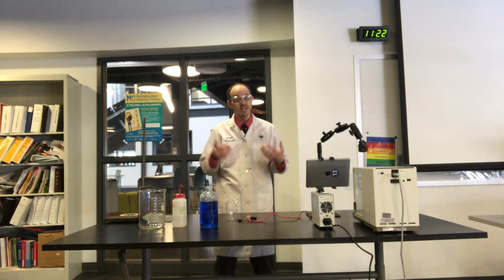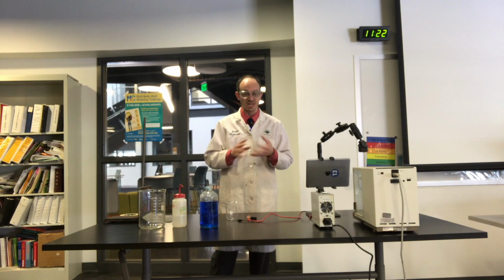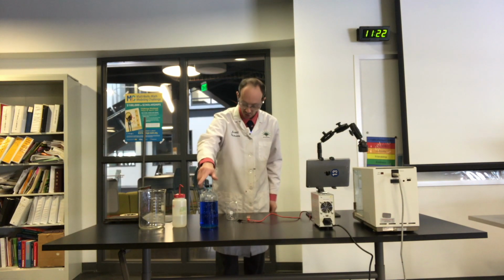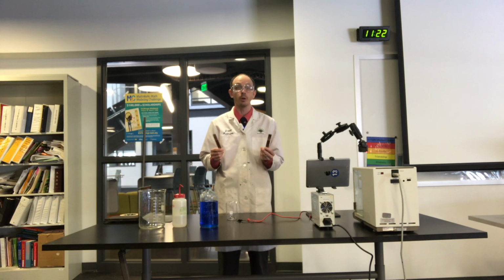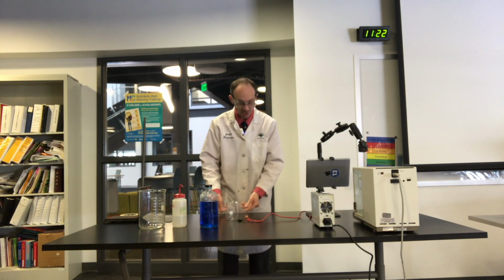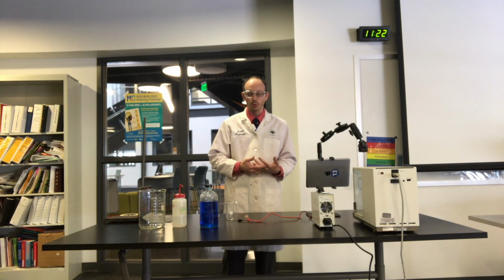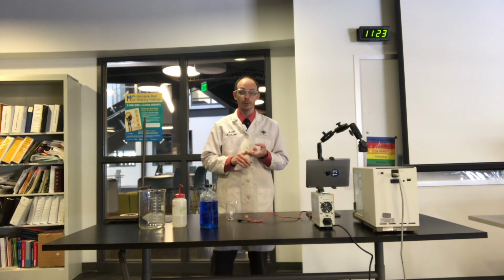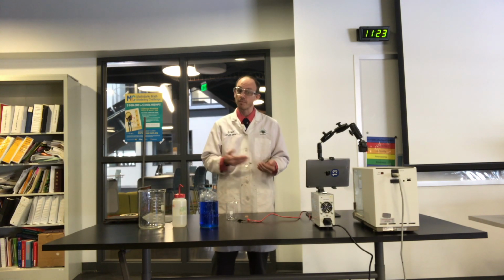Okay, ladies and gents, today we're going to do another electrolysis, only we are going to just be using copper and copper sulfate for today. Because all we want to do is transfer copper from one electrode to another electrode and be able to trace the mass that's changing by observing the amperage that's coming through it. Because the work that we've been doing in class so far has been taking a time and an amperage and turning it into coulombs of charge, or using Faraday's constant, the amount of electrons that have been transferred.